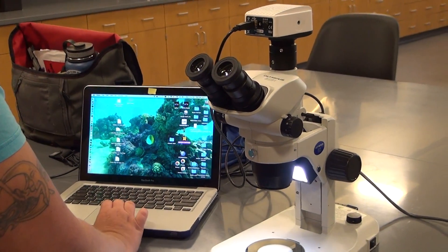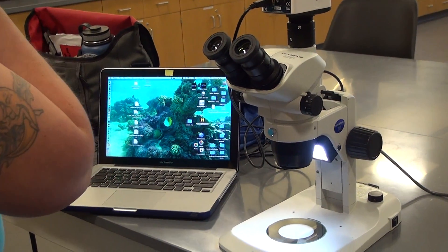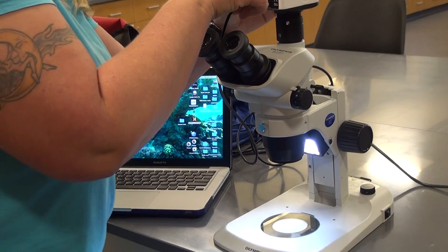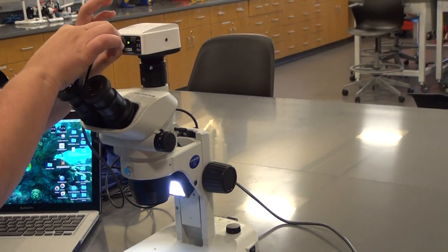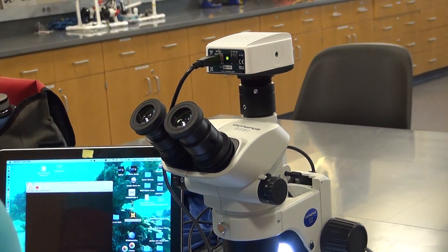Troubleshooting. Let's try again. Let's reopen the program. Oh, that's why, because it wasn't connected. The cord wasn't connected all the way. Now the green light is on, telling me that it is connected.